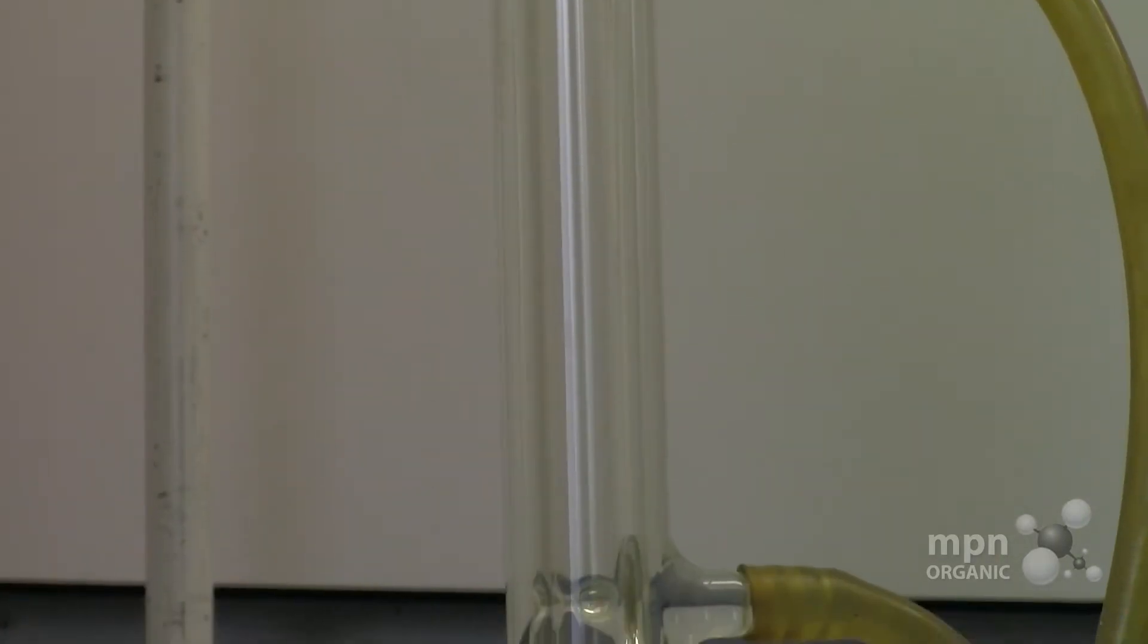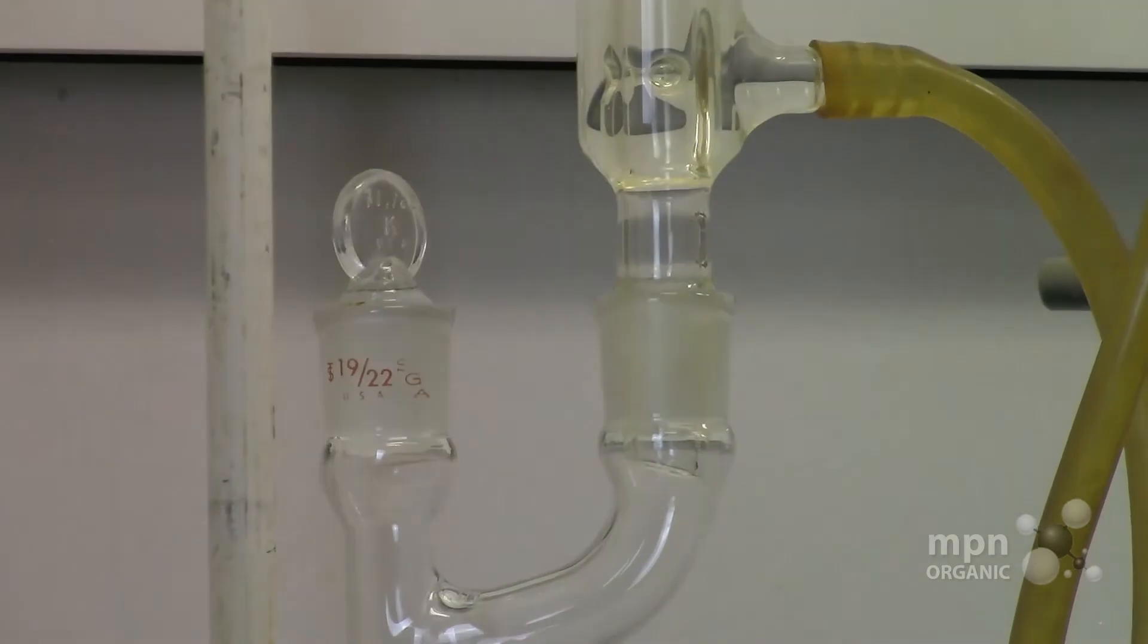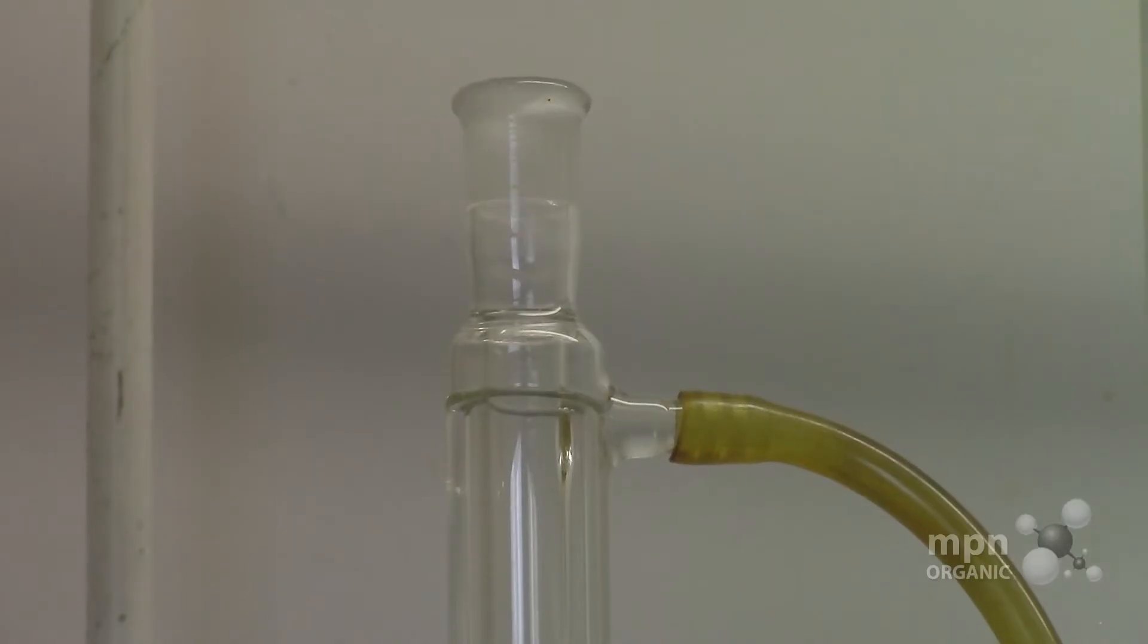Okay, so make sure that this is closed right here. Do not put a stopper on here. Don't close this. This is true for any reflux. It's just no good. You don't want a closed system in here.